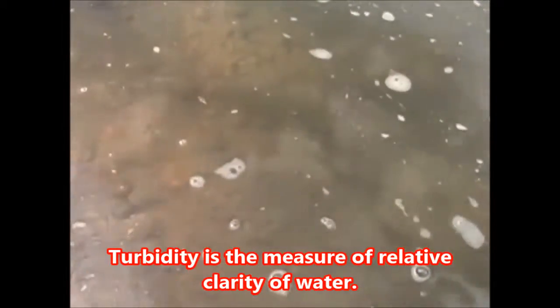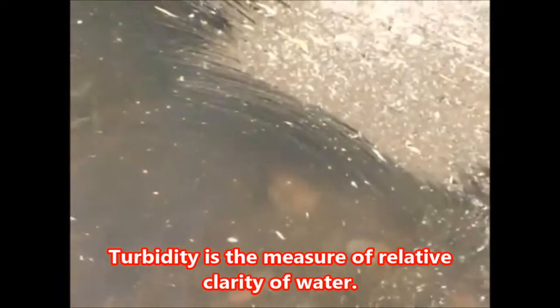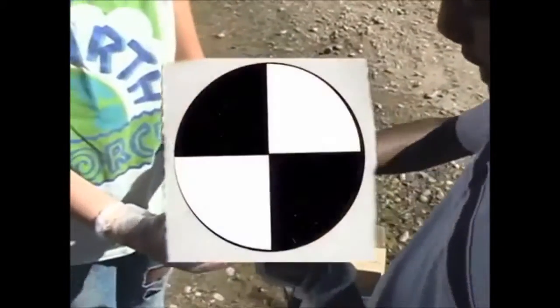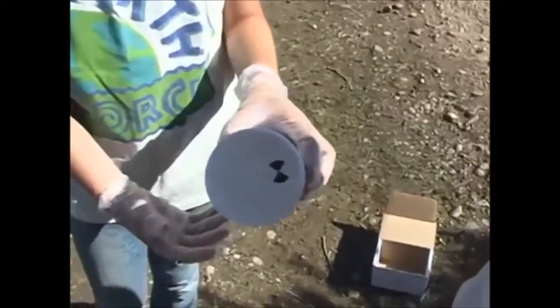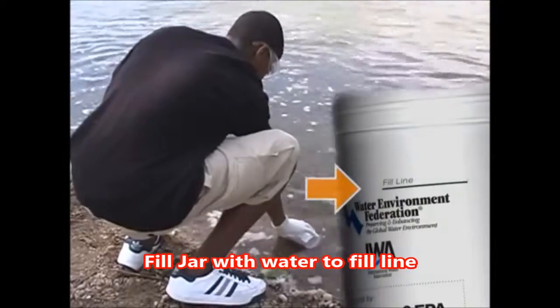If organic debris, sand, or silt is suspended in the water, it can prevent sunlight from reaching aquatic plants and can smother habitats for fish and other aquatic animals. For this test, just affix the small circular black and white decal to the inside bottom of your sampling jar. Then fill your jar to the fill line with water from your site.